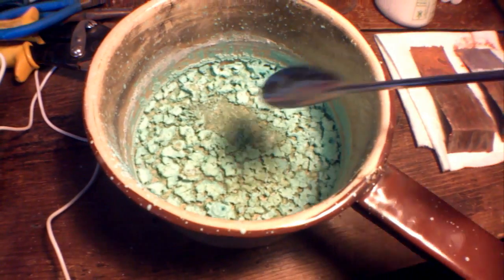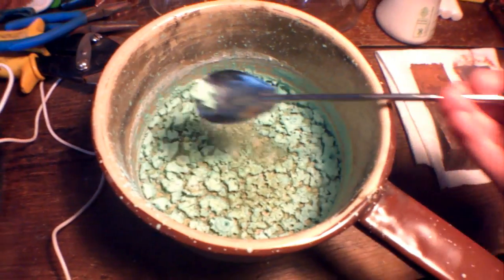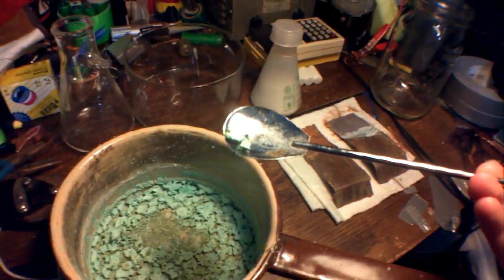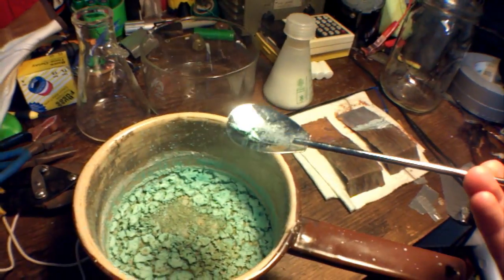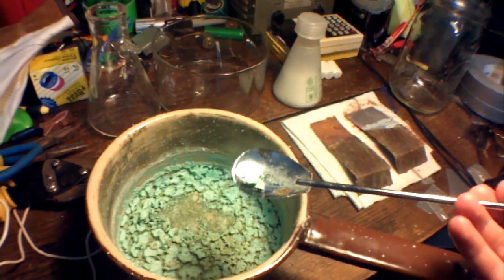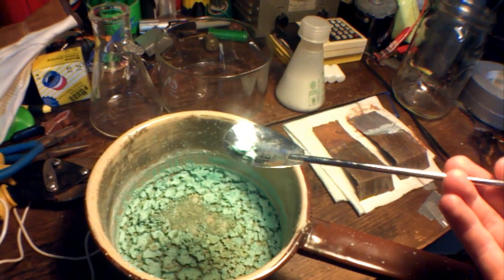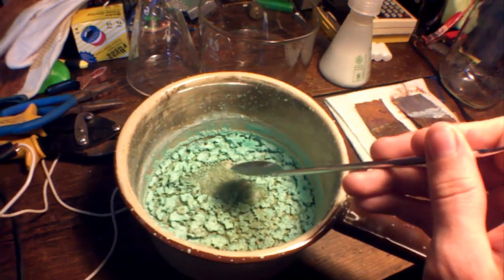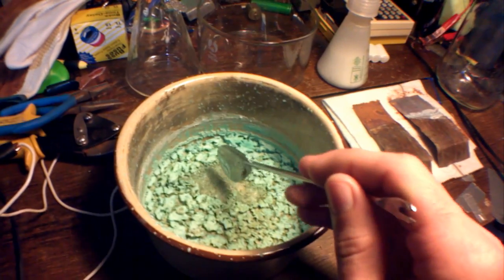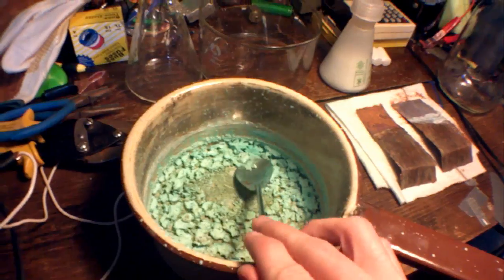Whenever copper hydroxide reaches 80 degrees Celsius—about 180 degrees Fahrenheit—it loses the hydrogen atoms, I think, and it degrades down into copper oxide. So that's kind of interesting.